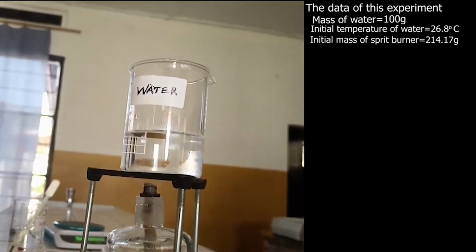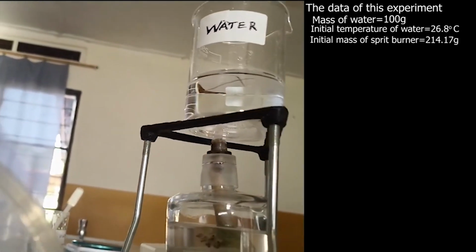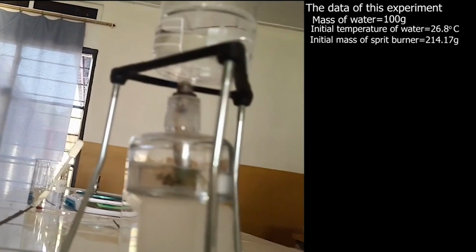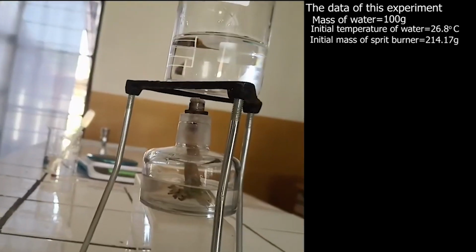As you see, the spirit burner is placed near a beaker containing water in order to minimize loss of heat by convection or radiation.